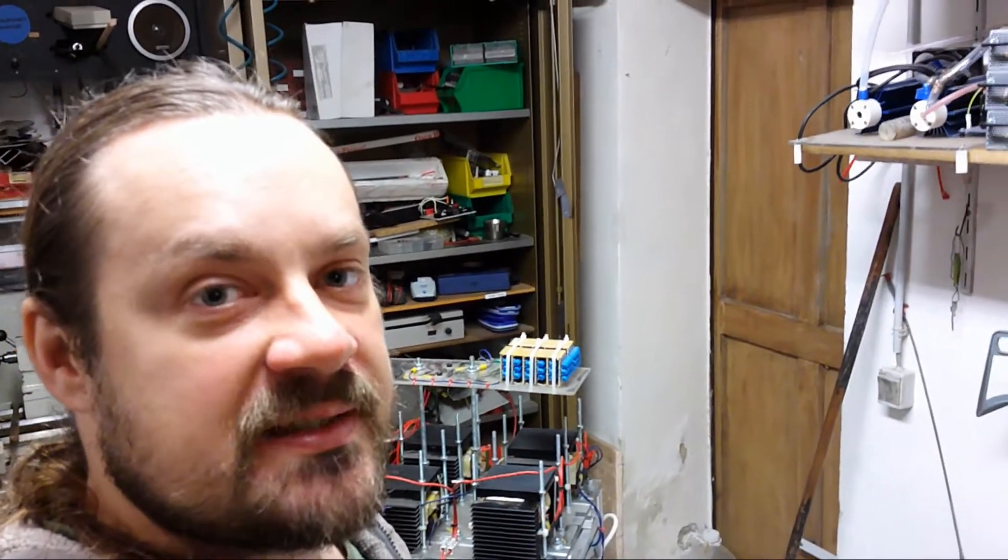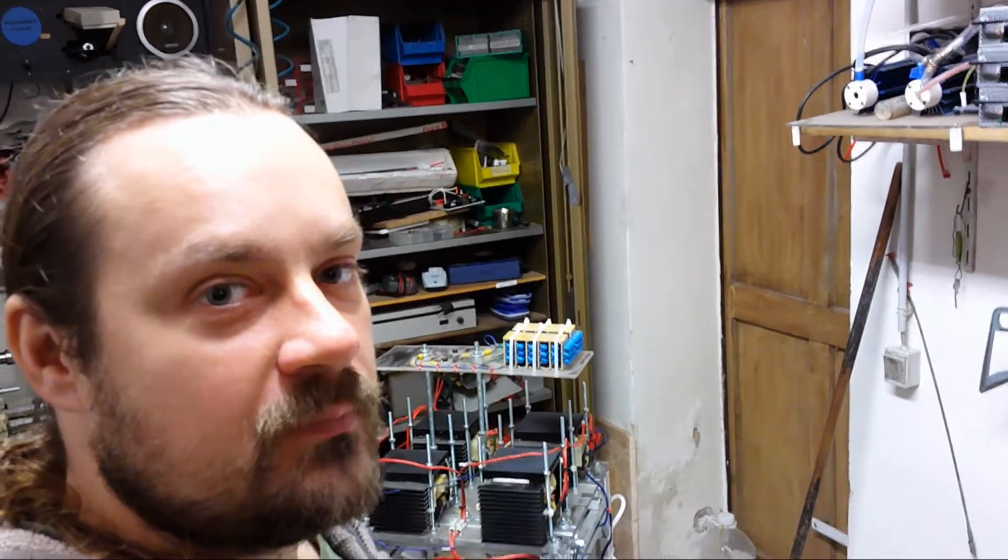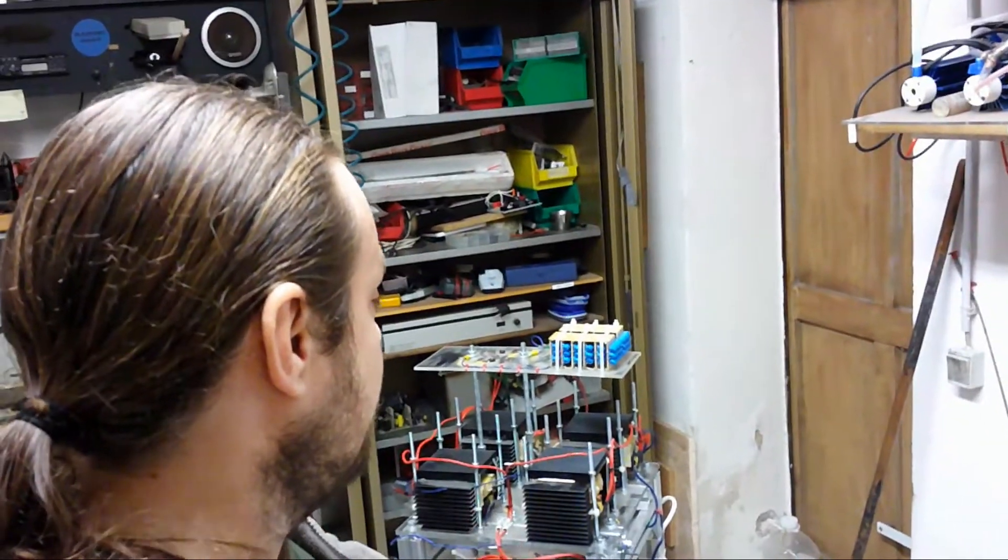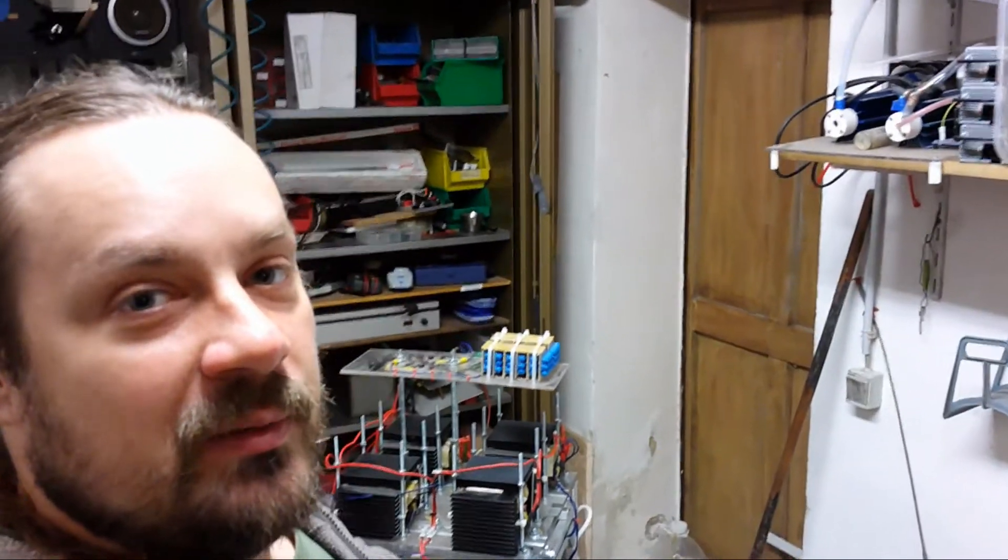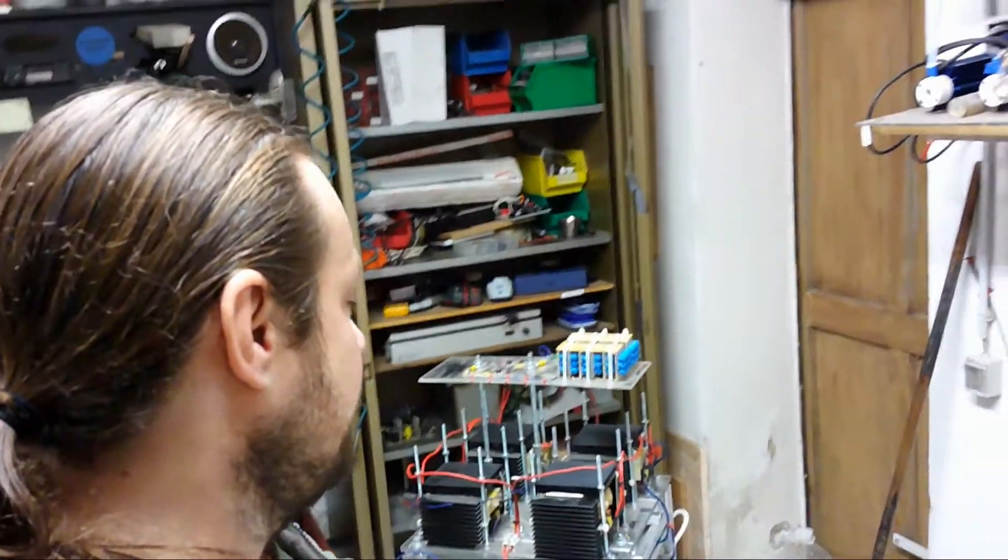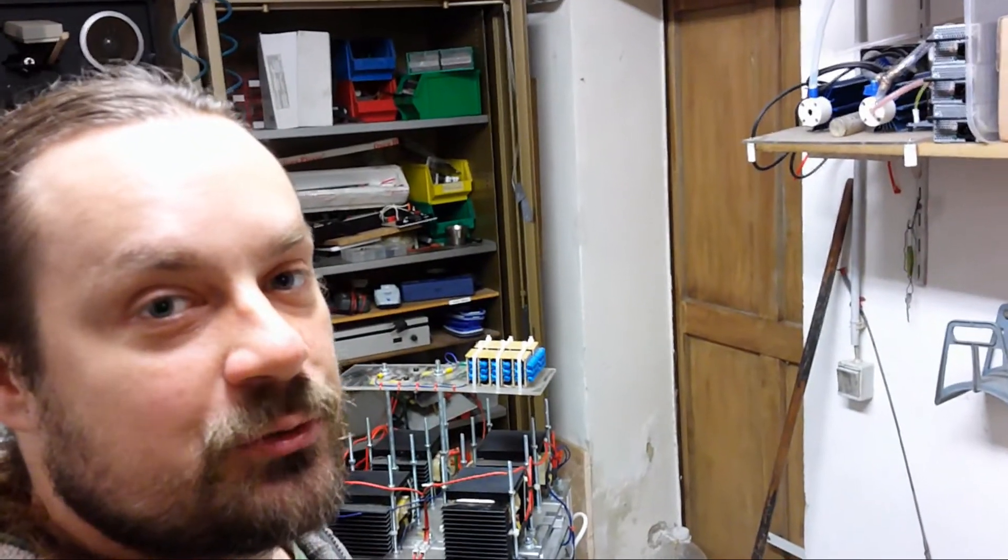With the NO2 gas it's possible to produce nitric acid from air. Currently this device is not working because over the years I have used it to get spare parts and to build other things from it.